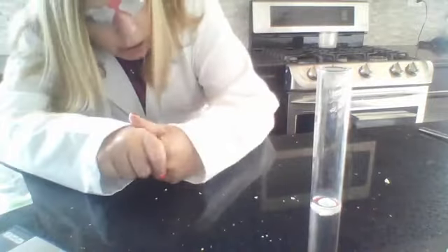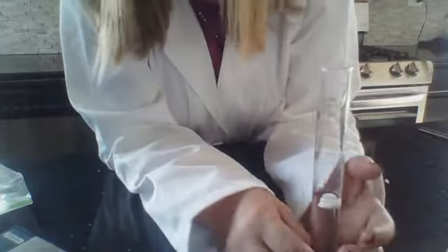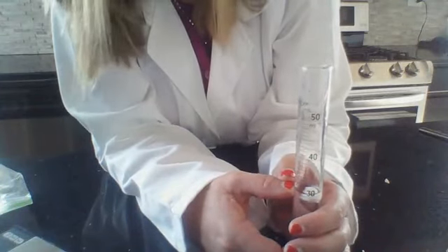It wants to flow just a little bit. But when I look at it, I can tell I started at 30. Have you guys take a look as well. I started at 30, and if I bring my camera down, you can see that I have gone up to 31 milliliters. 1 milliliter above, but remember a milliliter is also equal to a centimeter cubed for a solid. So you should have written down 1 centimeter cubed for the volume of our soap.